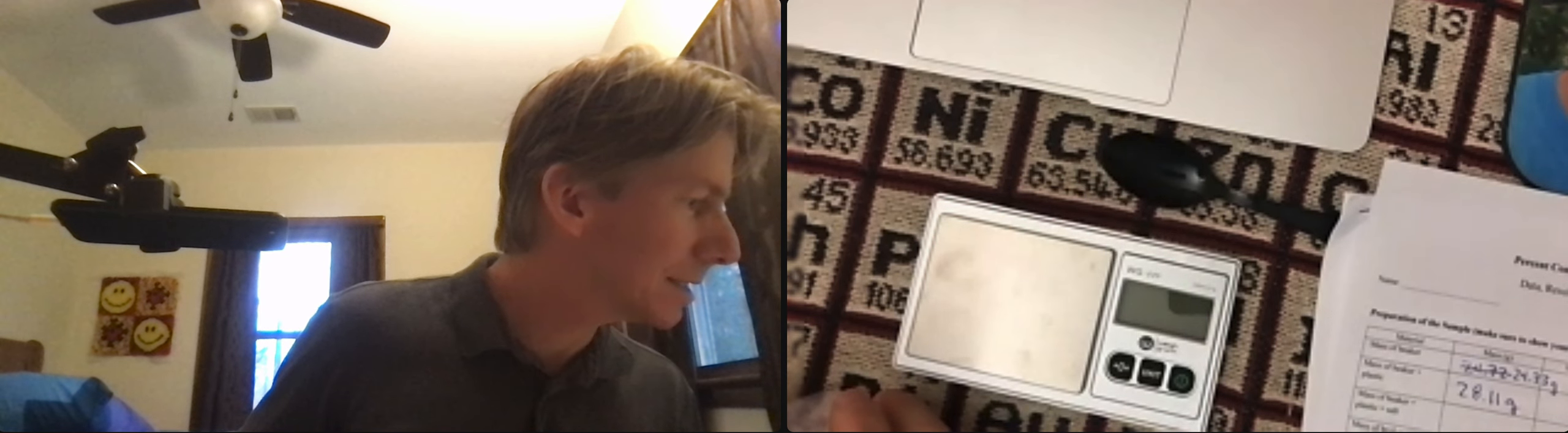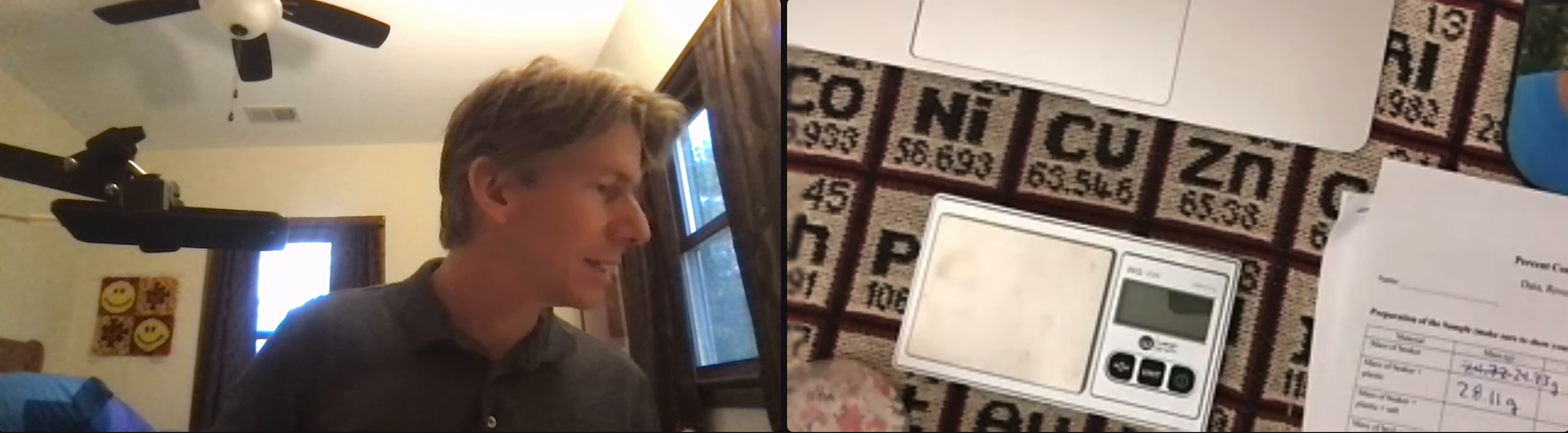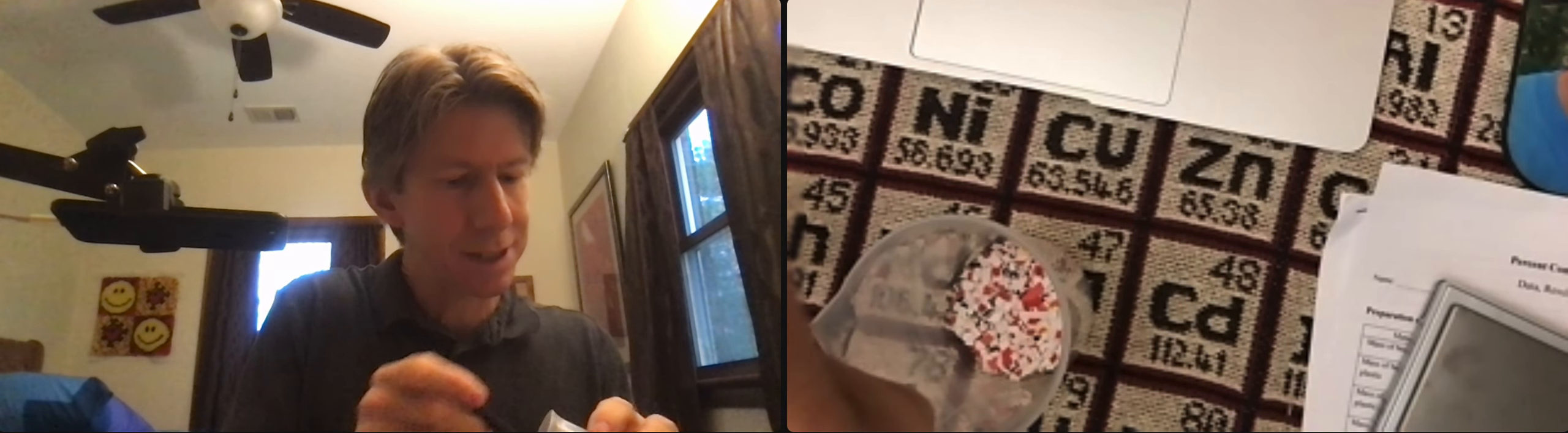It says a spoon—a regular spoonful of salt into the beaker—and I've got some salt here. I'm not going to do this on the scale. Let's see, looks like I got just about a spoonful so I'm going to just pour the whole thing in.